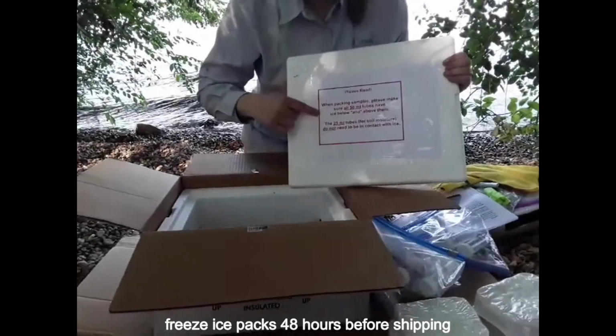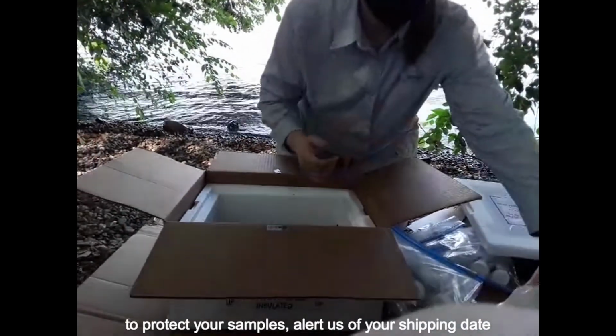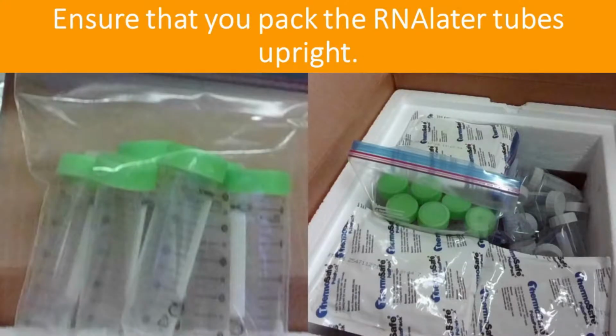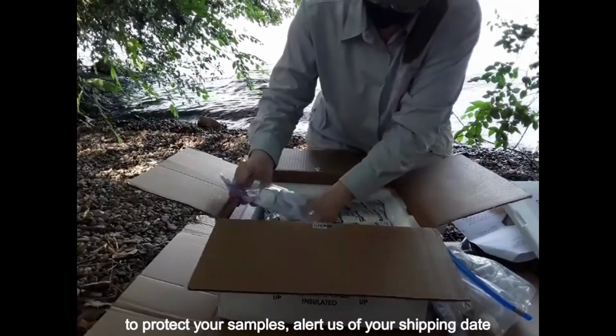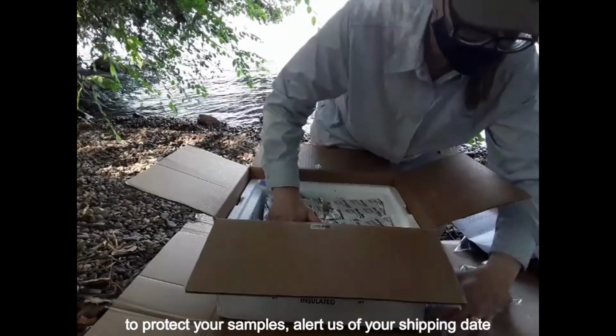In the sediment kit sampling box, place some ice packs into the box on top of the provided absorbent padding. Put the 50 ml tubes into the provided Ziplocs and then place them on top of the ice packs. All sample tubes must be inside of a Ziploc bag. Place the remaining ice packs on top and around the 50 ml sample tubes. The most important component is to have the 50 ml tubes as cold as possible. Pack the 25 ml tubes in the remaining space. Their temperature is not as critical. They don't have to be surrounded by ice packs.